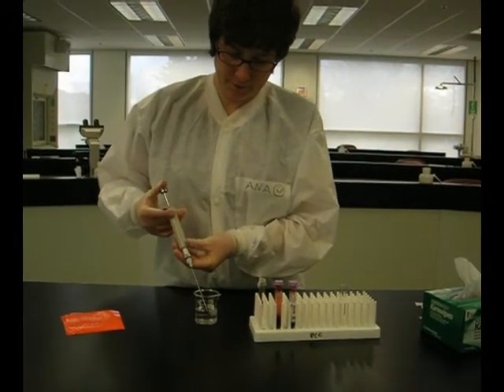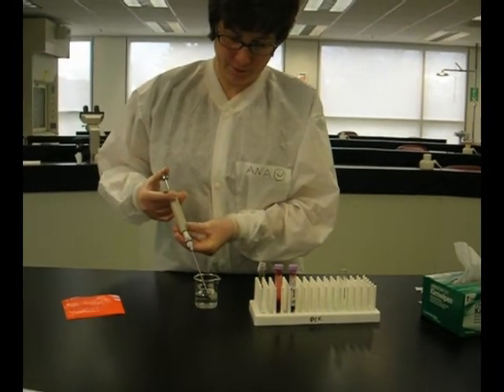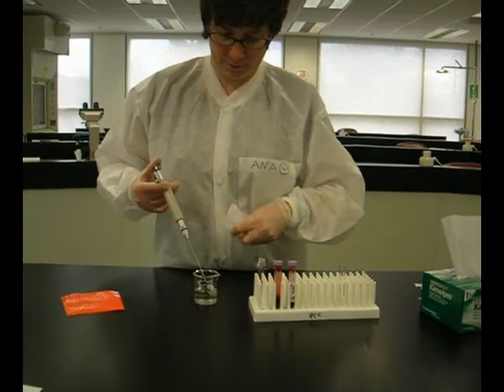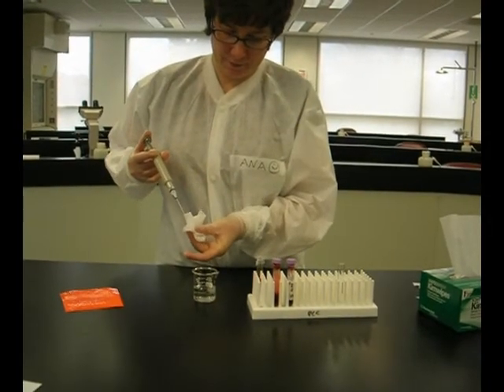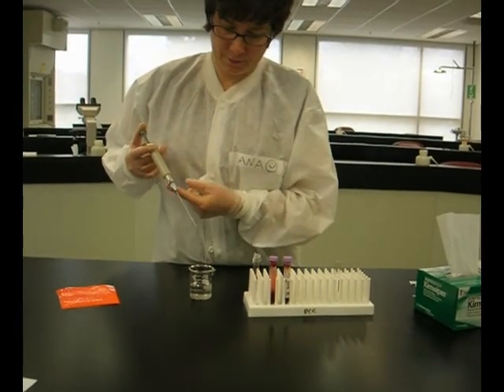Rinse the micropipette in deionized water a couple of times and carefully wipe it. You are now ready to pipette another sample.